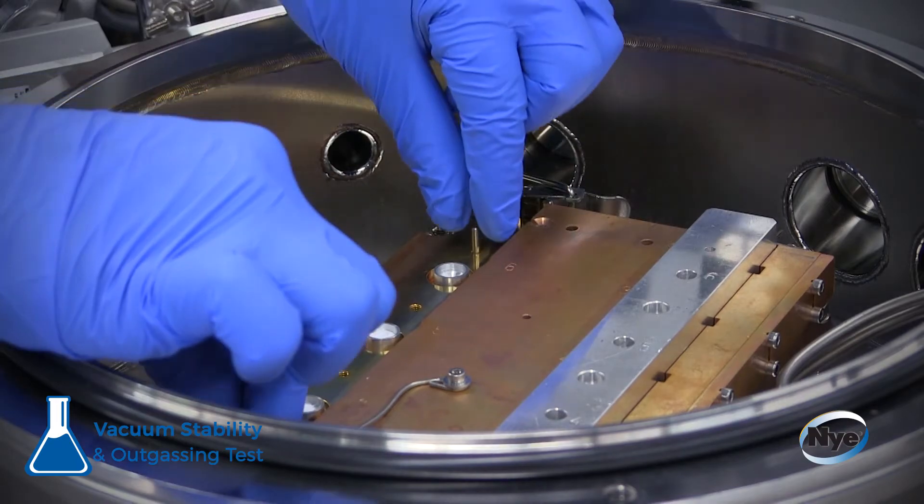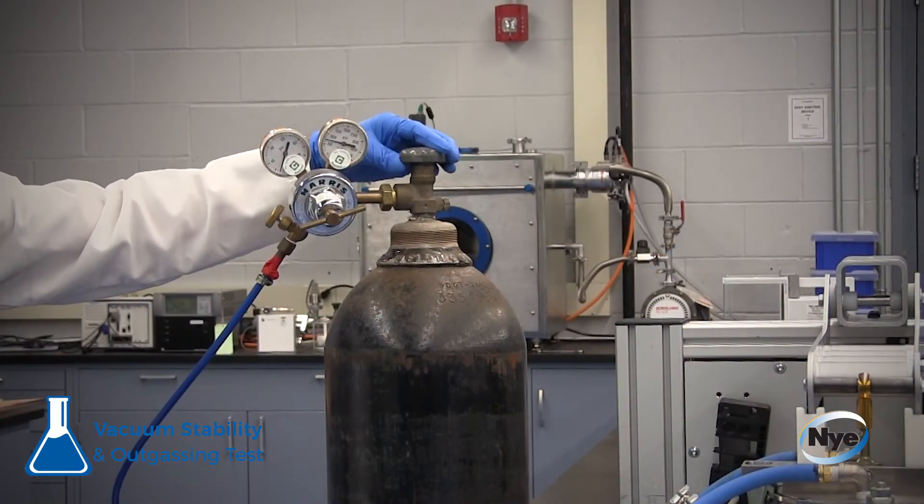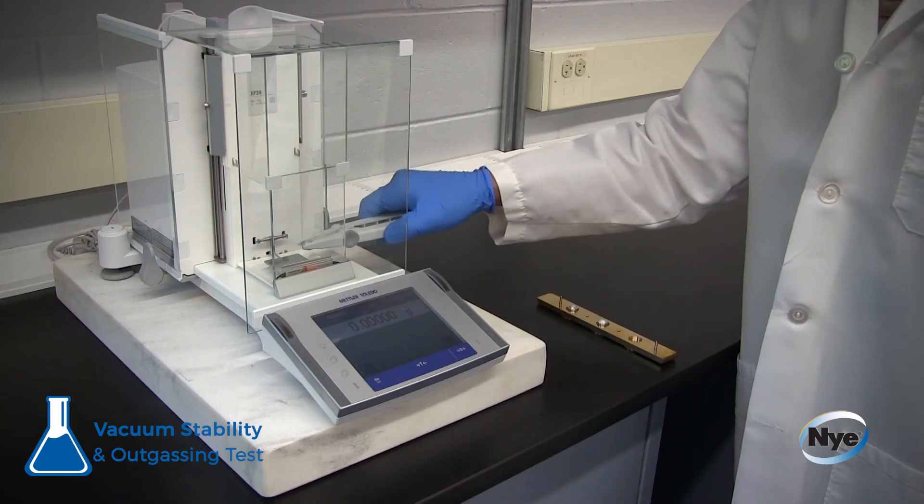After 24 hours, the test apparatus is cooled and the vacuum chamber is re-pressurized with a dry, inert gas. The samples and the collector plates are then weighed.